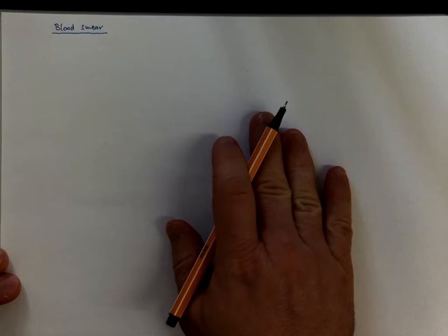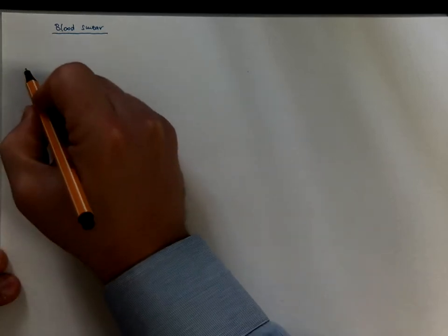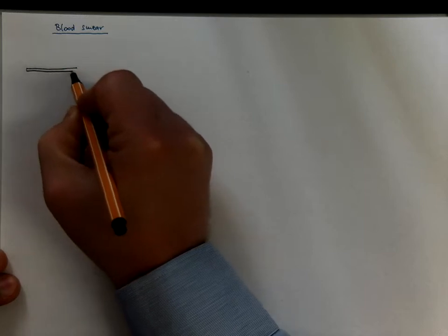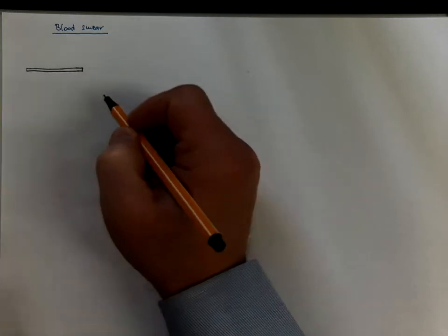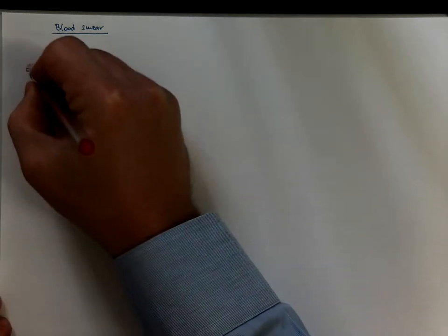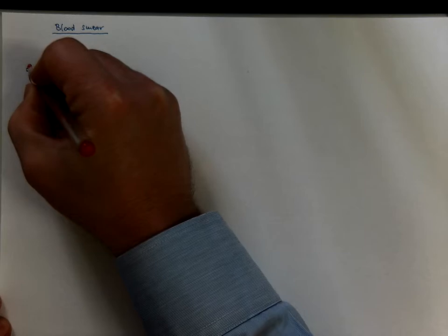If you want to observe the morphology of peripheral blood under the optical microscope, you mostly need to prepare a blood smear. So this is a simplified explanation of how to do that. You will need 2 histological slides for that. That should be clean.